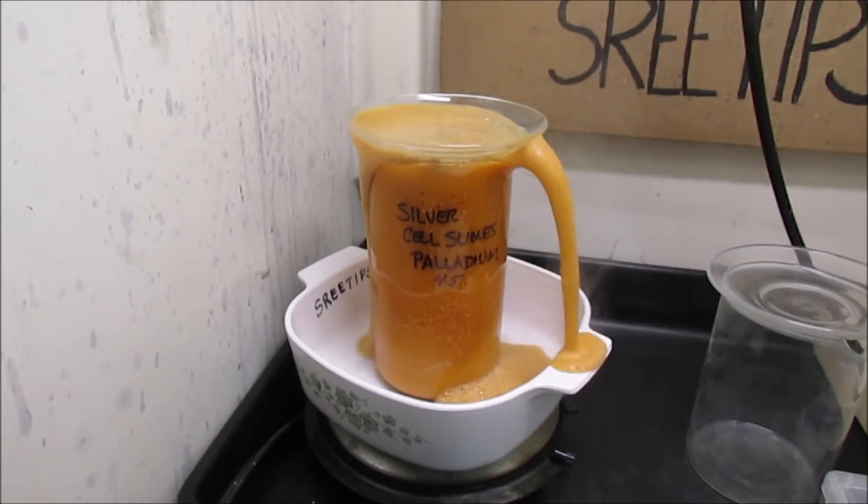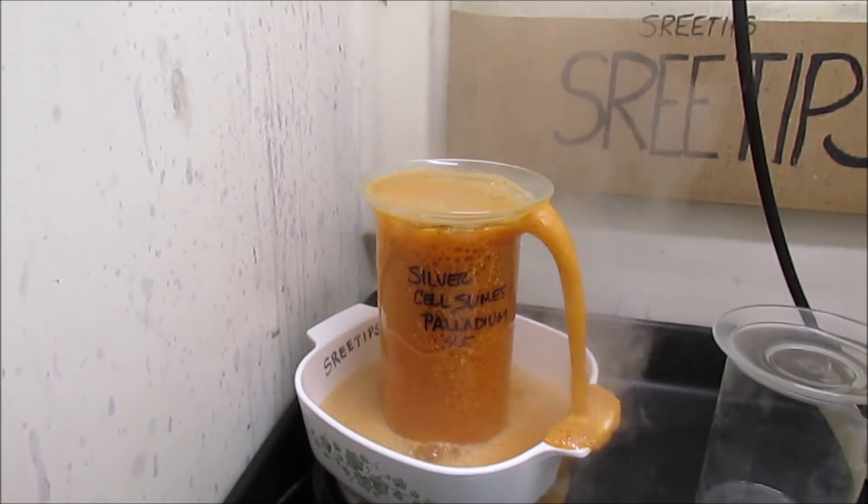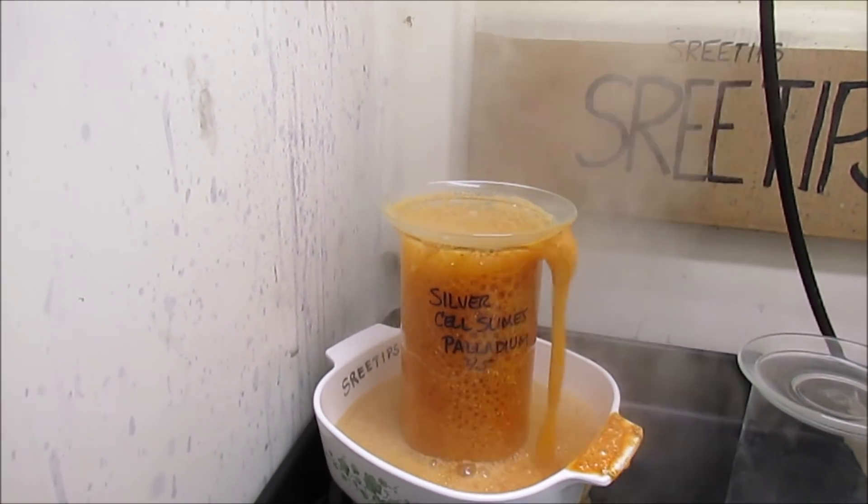Here we go, disaster. Added too much nitric.